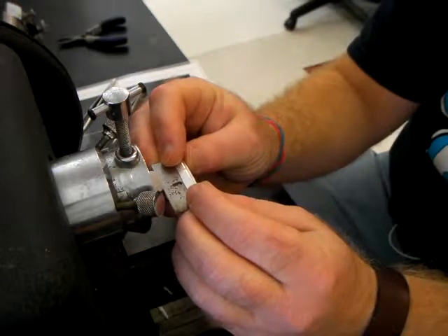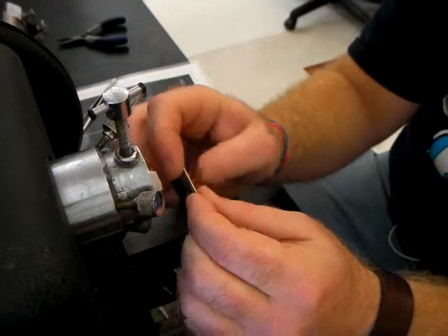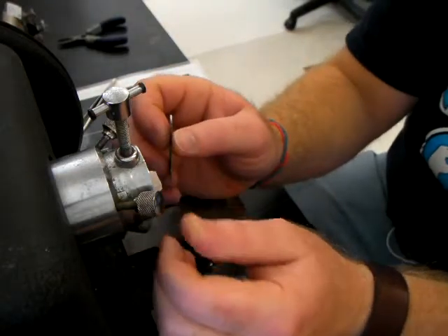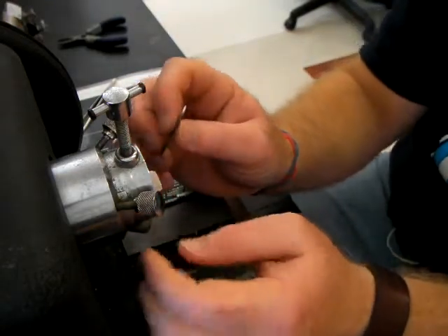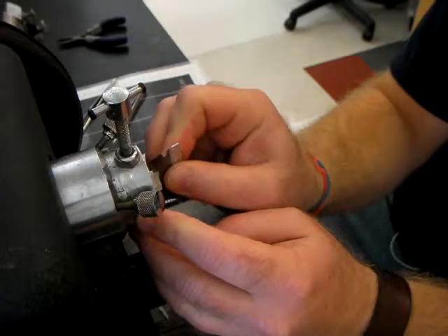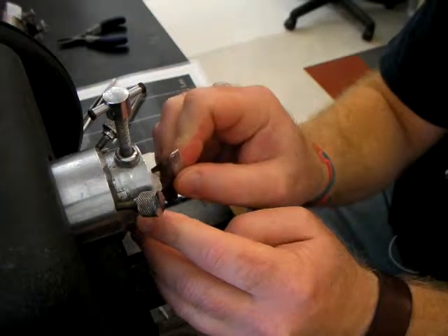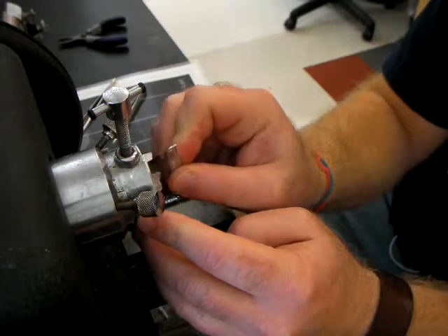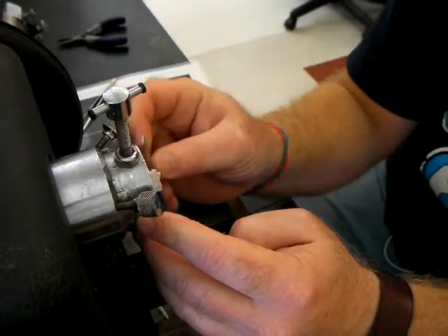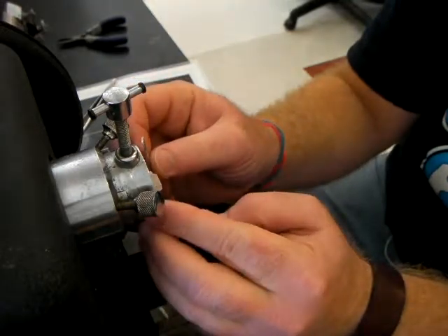Make sure you trim away enough of the paraffin around the specimen so those lines will remain parallel throughout the depth of the paraffin that holds the specimen. You do not want to get to the last couple of sections and have built-up paraffin at an odd angle ruining those last sections. Once you've got that, you can trim the block on the sides of the specimen to remove any excess paraffin so that your ribbons come out the minimum size needed for mounting on the slides.